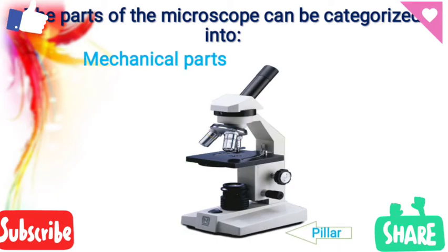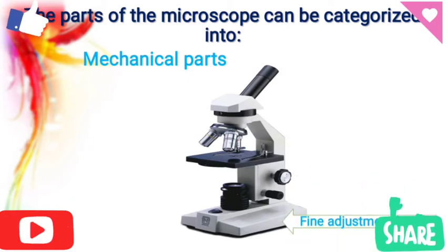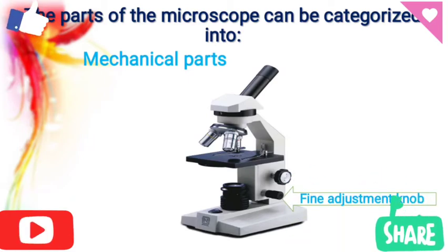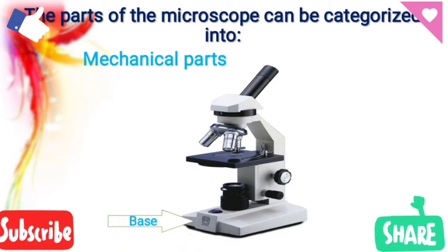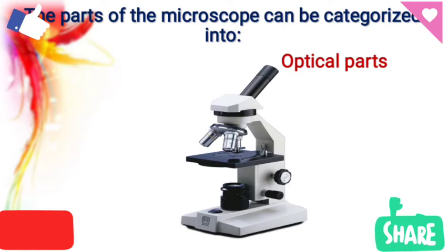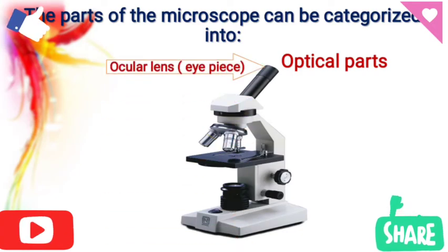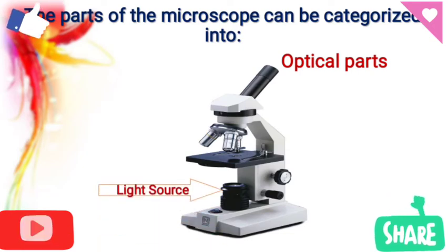Diaphragm. Pillar, coarse adjustment knob, fine adjustment knob, then the base. Now let's see the optical parts. Ocular lens, eyepiece, objectives, then the light source or the mirror.